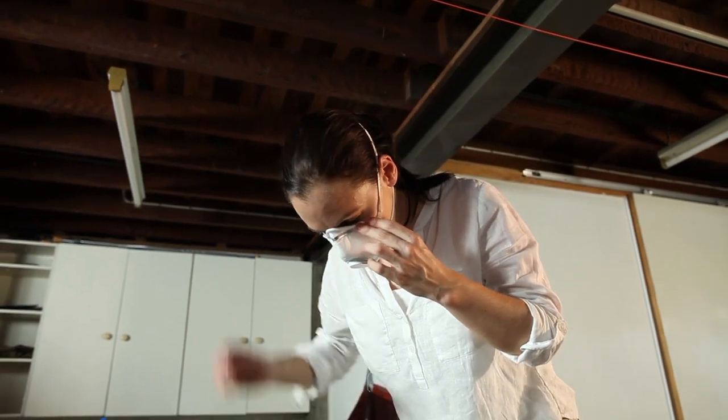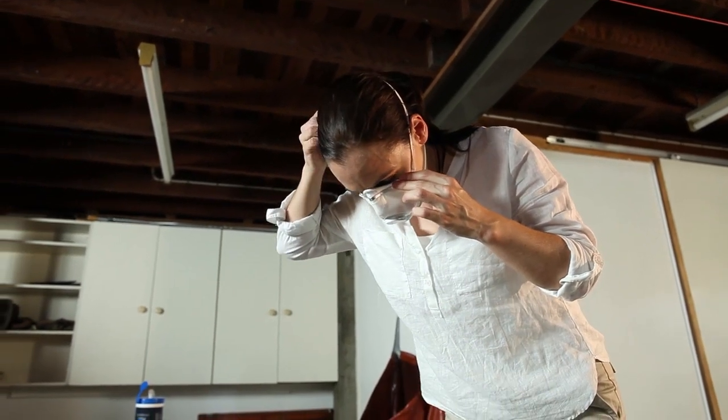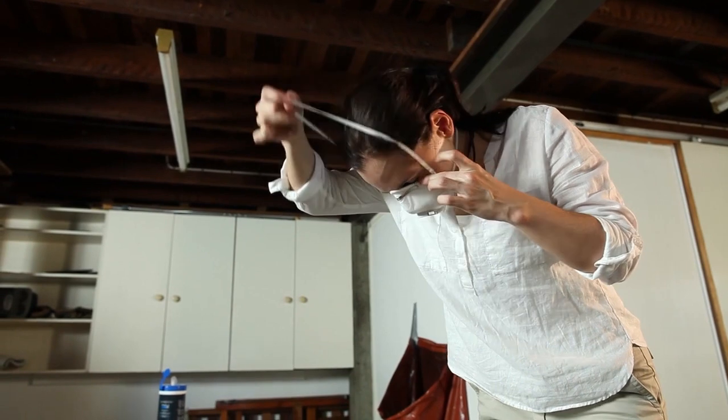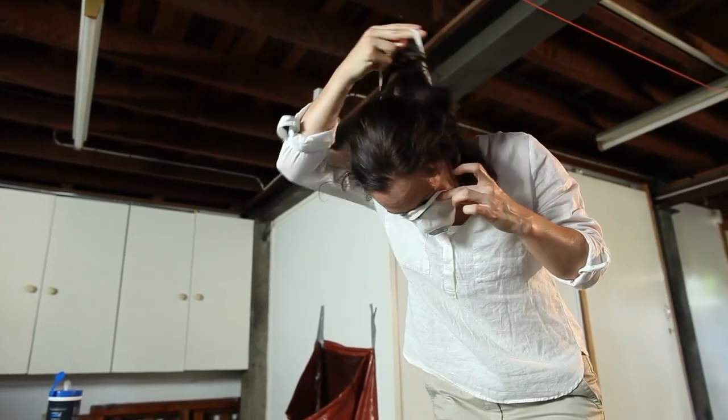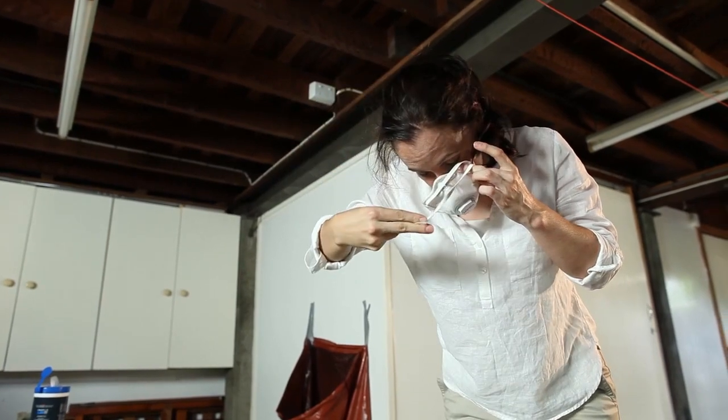Finally, remove your respirator. Removing your respirator last will protect you while removing all other PPE. Lean forward and remove it from your face by the straps, taking care not to touch the front.